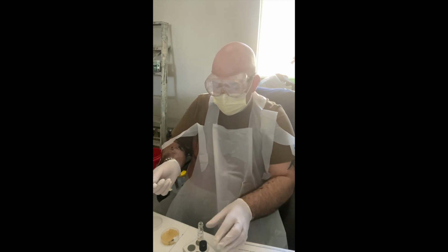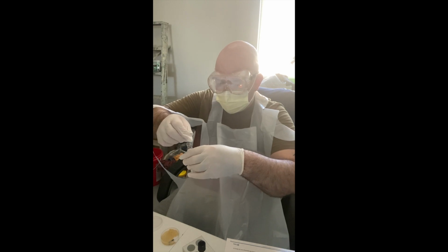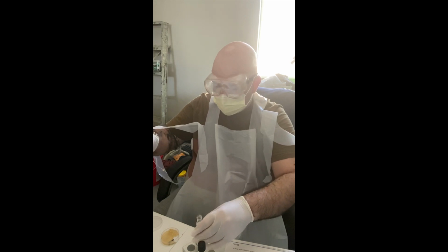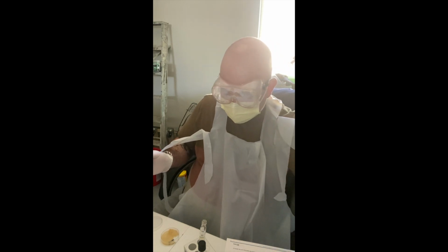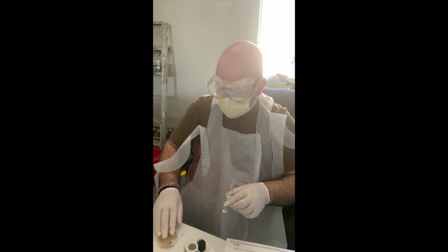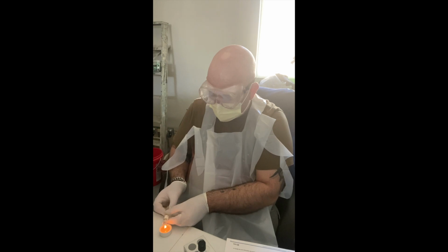Now this is going to go straight into the tube here, one way in, same way out. And that's it. This is going to go into some bleach. Let's put the lid back on the E. coli, move it to the side. Flame this tube.